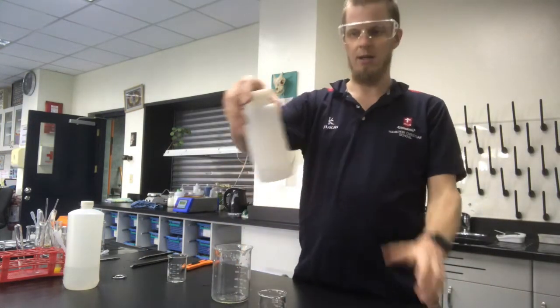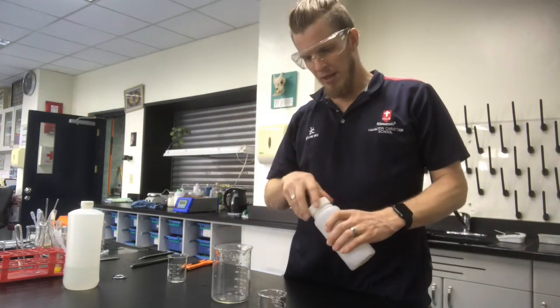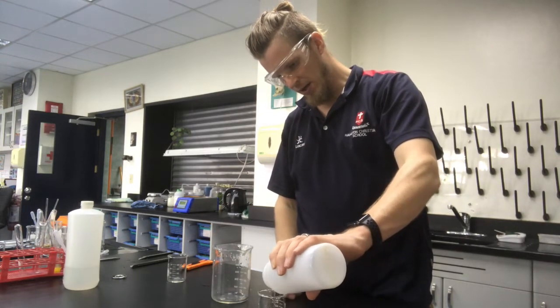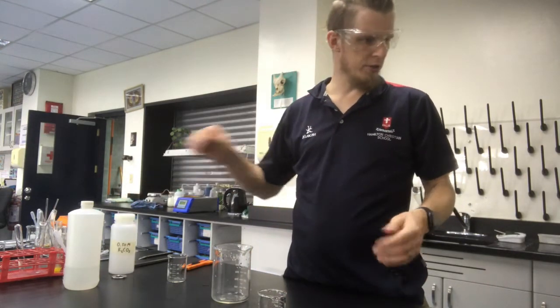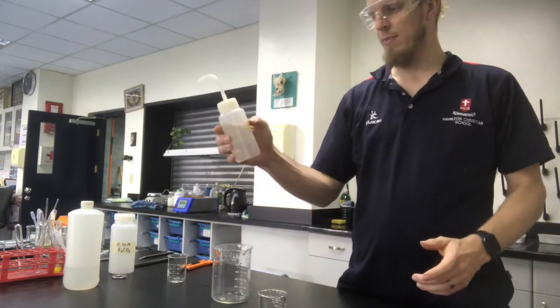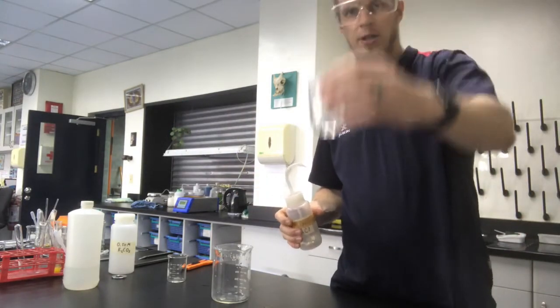In here I've got some potassium carbonate, and carbonates love to degrade into carbon dioxide. Here I've got some hydrochloric acid, again a colorless solution.